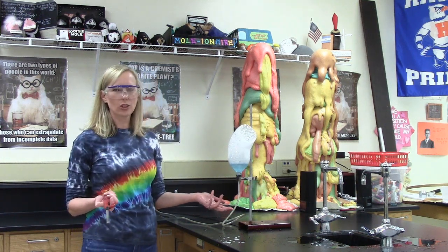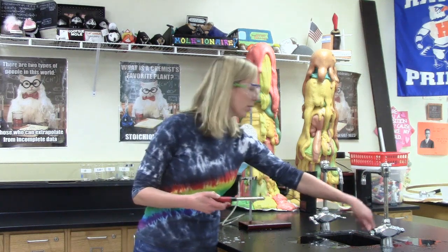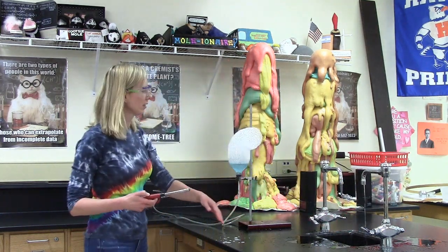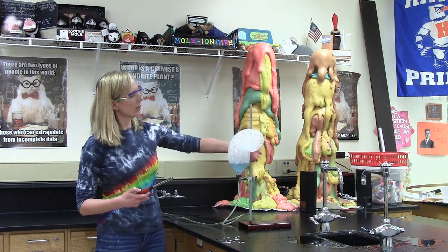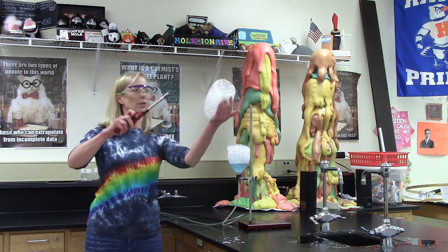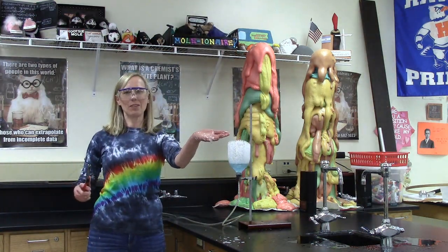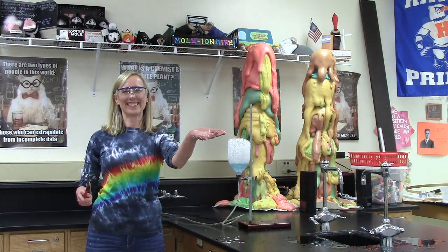Let's do one more just for fun. Again, I'm going to make sure I've got lots and lots of water on my hand. We're going a little crookedy now. Small scoop. And we've got a combustion reaction.